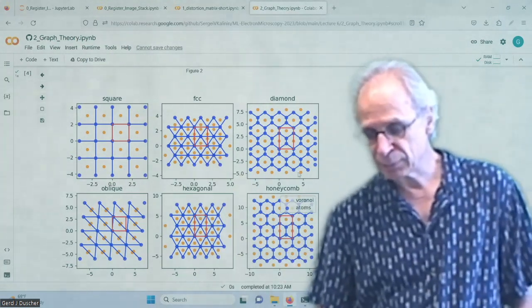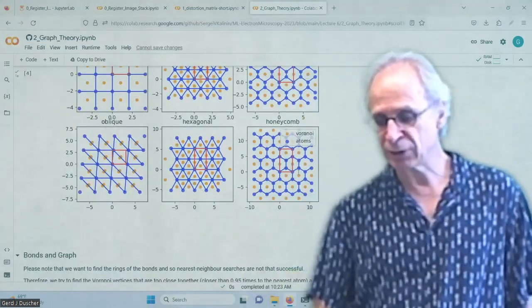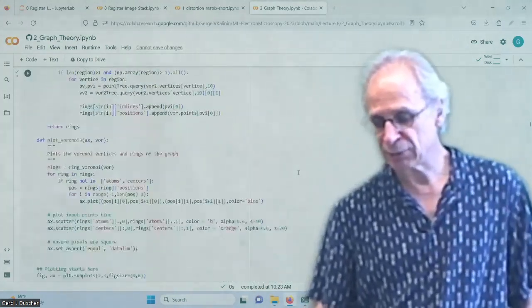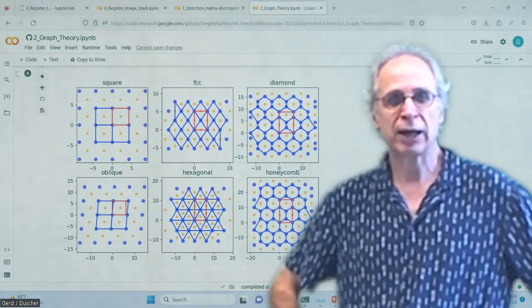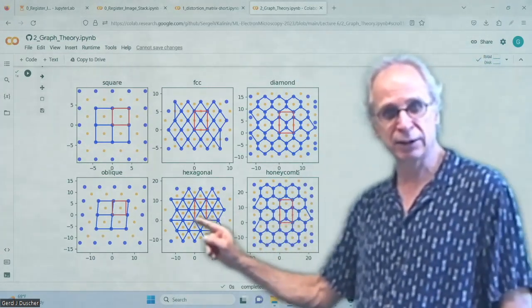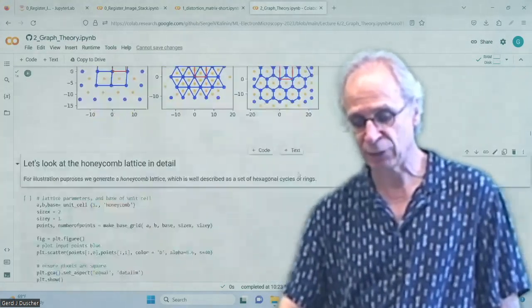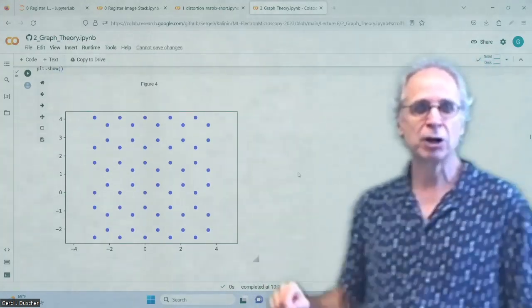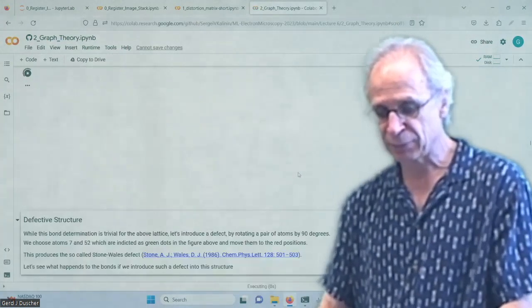So for a hexagonal system, I get bonds in all directions, obviously, and in an FCC case, I would get them. Is the middle one missing? Okay, so that gets me extremely close to what I want to see from a projection of a crystal. So the honeycomb versus the hexagonal diamond, all of them are now exactly as I want them for the rings that I want. Let's look at the honeycomb one in detail. So this is just now a whole bunch of graphene atoms, molybdenum diselenide, whatever you have, right? So we have this honeycomb kind of lattice.